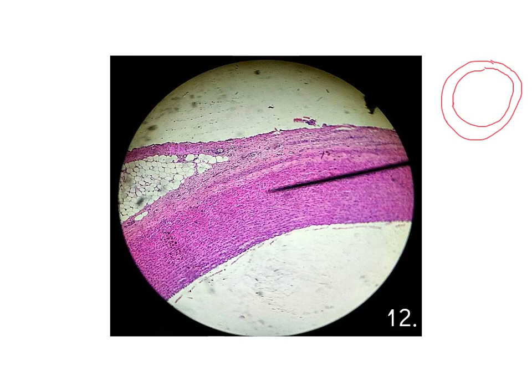Starting with the first hollow structure, the aorta. Here you can see that it is formed of a wall reddish in color, and the cavity inside, the lumen, is white or empty. And you don't have anything attached on its surface.